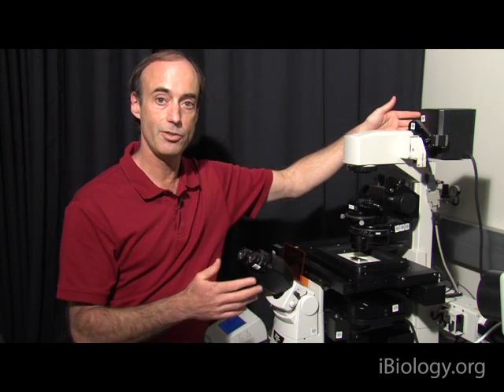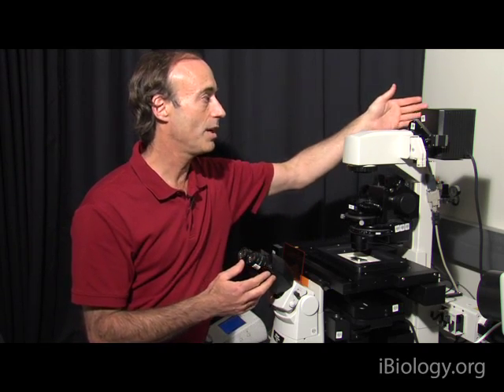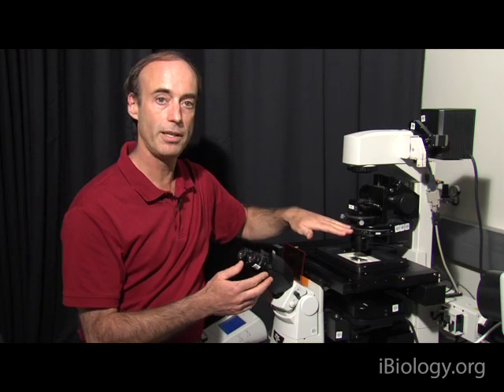The other goal of Köhler illumination is to have even illumination of the specimen from the illuminating source. The way we do that is by projecting the image of the lamp onto the front focal plane of the condenser lens. Light diverging from a focal plane will emerge from a lens on the other side as parallel light, and that's what we want. We want parallel light bathing the specimen because that provides the most even illumination, and the light source will be completely defocused.